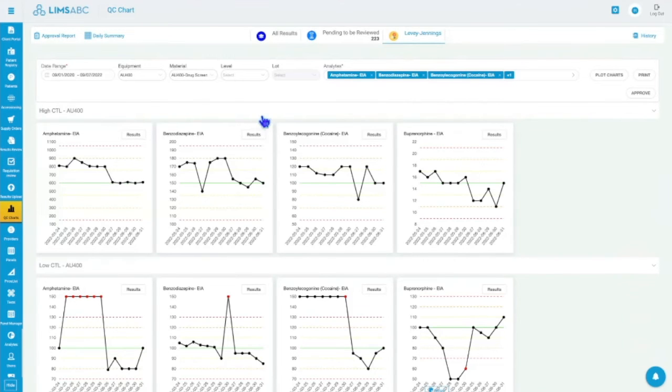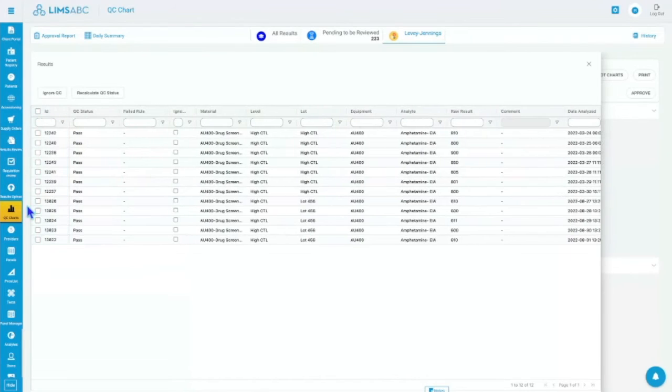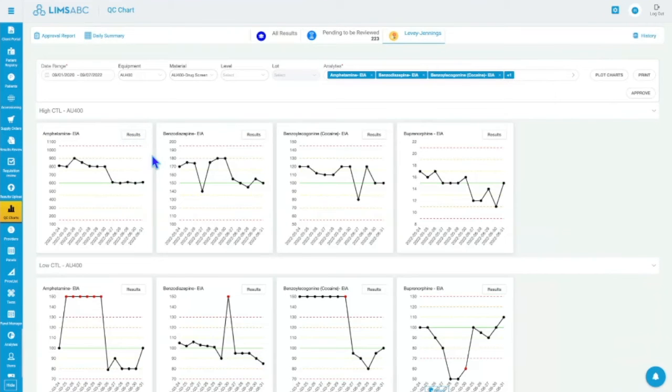There are a few options here, like I mentioned, comments. You can also choose to ignore the QCs, right? So for example, these ones, well, they're all passed in this case, but I can choose I don't want to have these plotted on my charts. I can choose to ignore and put whatever comment I want. You can ignore certain results, and you can put comments. You can change the results. I mean, usual stuff you can do from here.